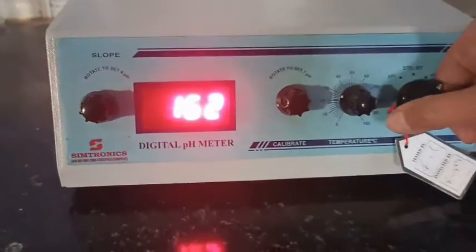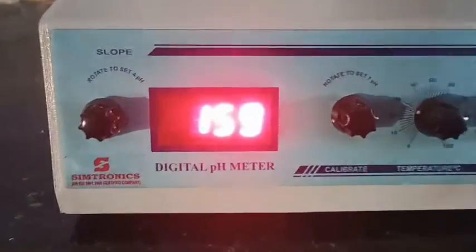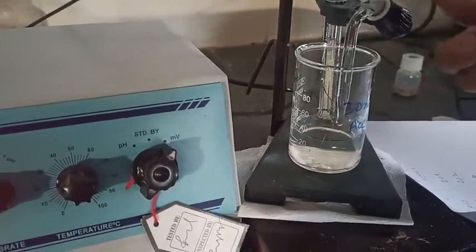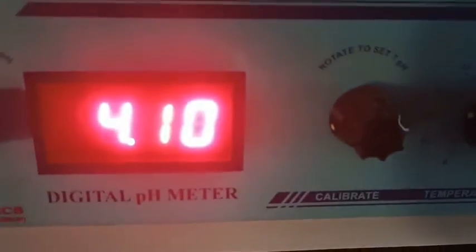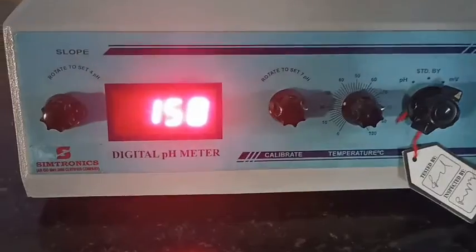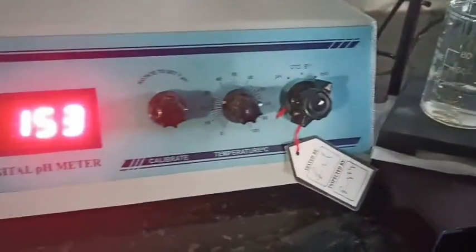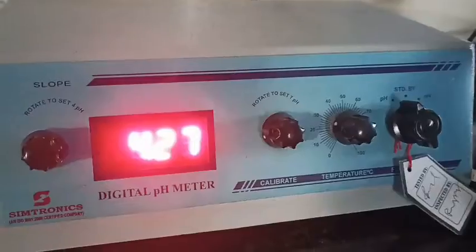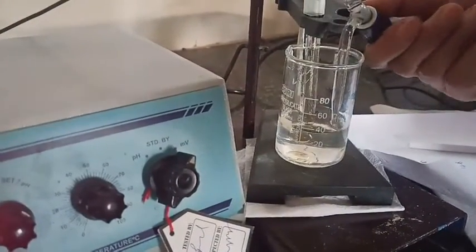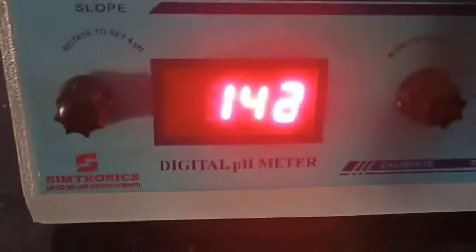We continue recording pH and potential values. The pH value at 8 ml is 4.02. Around the 10 ml mark I switch to adding 0.5 ml of NaOH at a time rather than 1 ml increments. After each addition I shake the solution and record the pH as well as the potential readings simultaneously — that is why we call this pH metric or potentiometric titration.